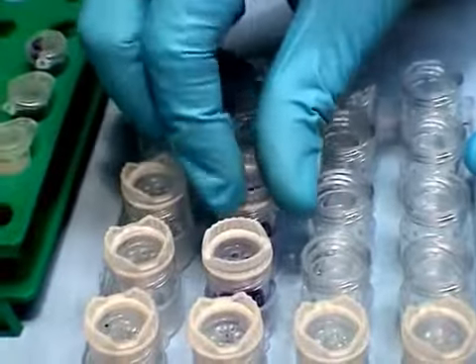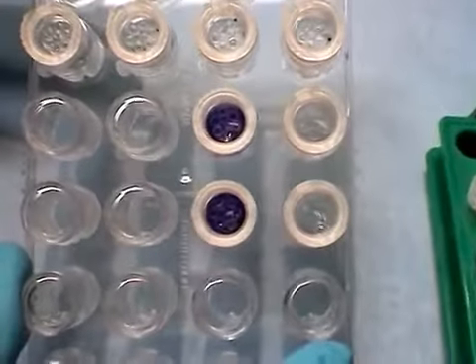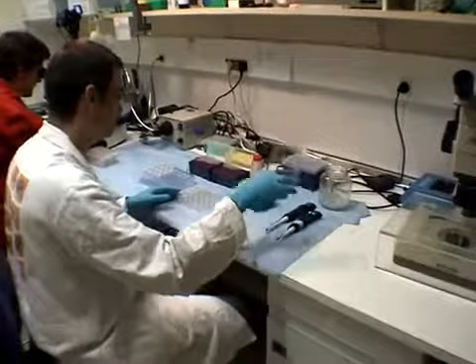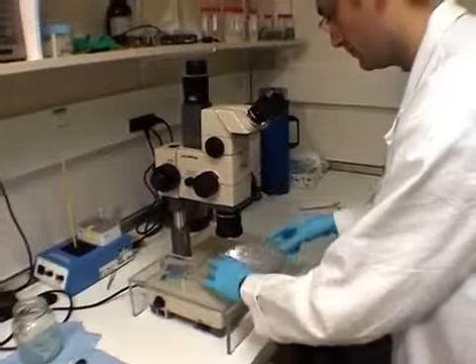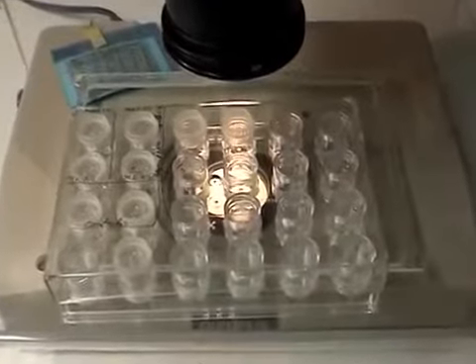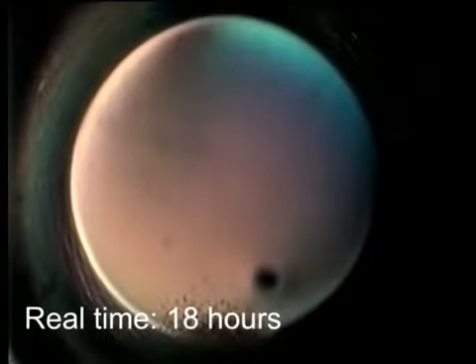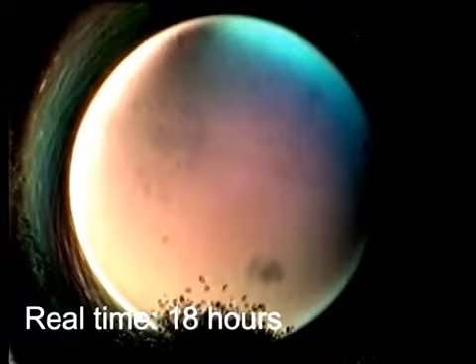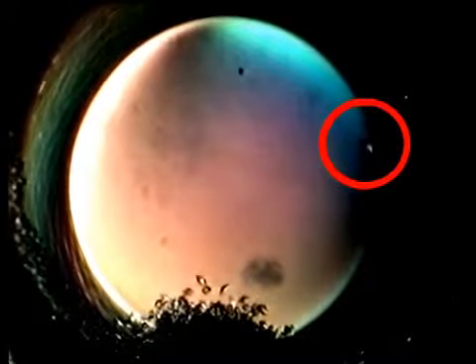After hermetically sealing the plate, the concentrated solution in the wells absorbs the ambient water vapor to dehydrate and thus concentrate the drop containing the target molecule and the crystallizing agent. This process of concentration makes the target molecule unstable in solution and causes it to crystallize. The crystallization occurs in a few hours or a few days and can be followed using a microscope.